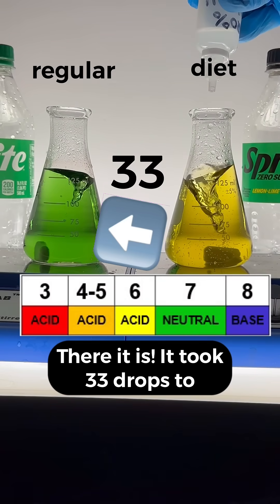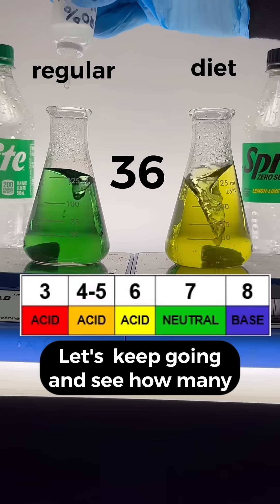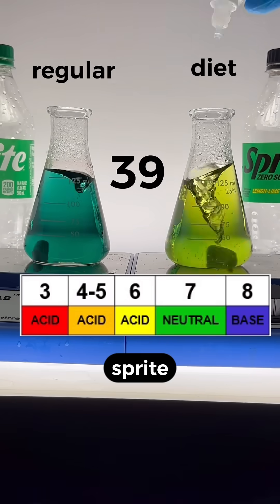There it is! It took 33 drops to neutralize the regular Sprite. Well, let's keep going and see how many drops it takes to neutralize the diet Sprite.